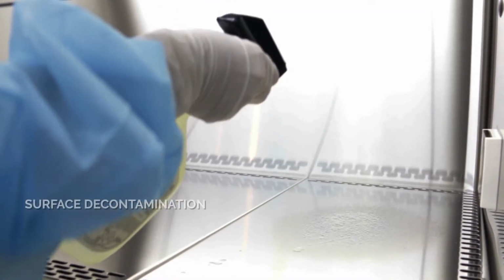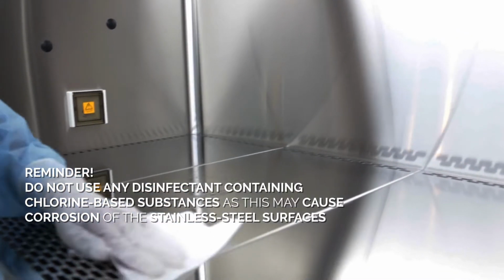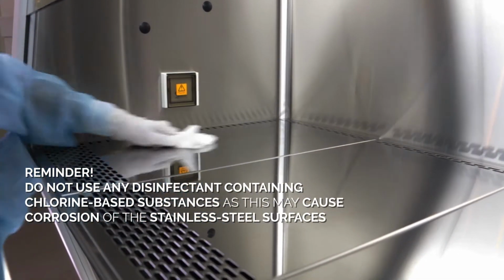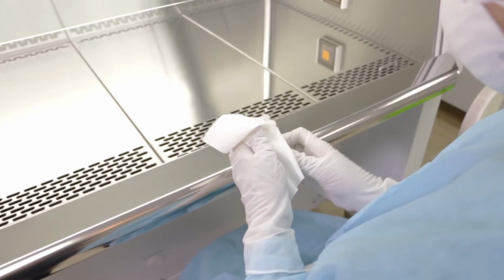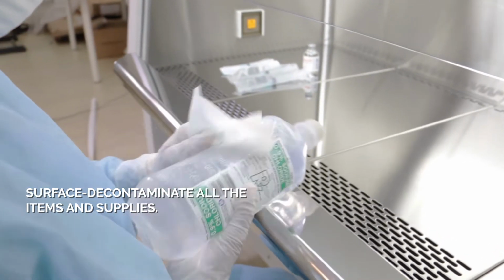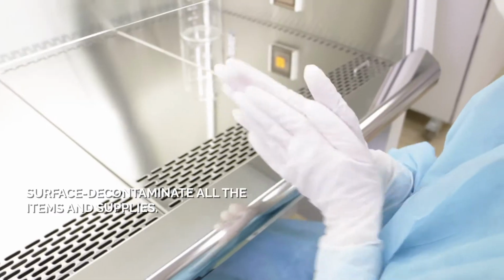Surface decontaminate the work area before using the cabinet. Ensure that the air intake and exhaust area of the cabinet is free from any obstruction. Ensure the front and back air grills are not obstructed by your arms or any other object. Surface decontaminate any items, including your arms or apparatus, with appropriate disinfectant before entering or exiting the work area.